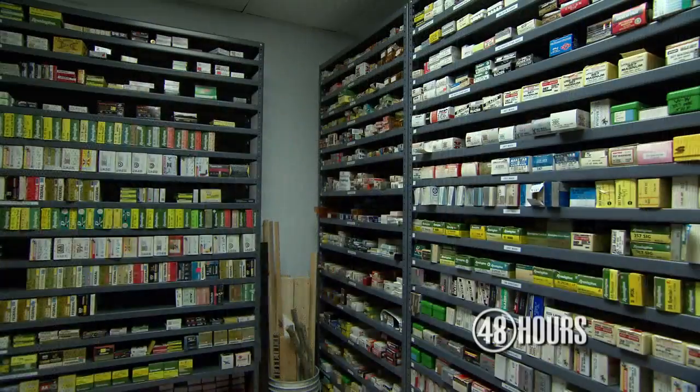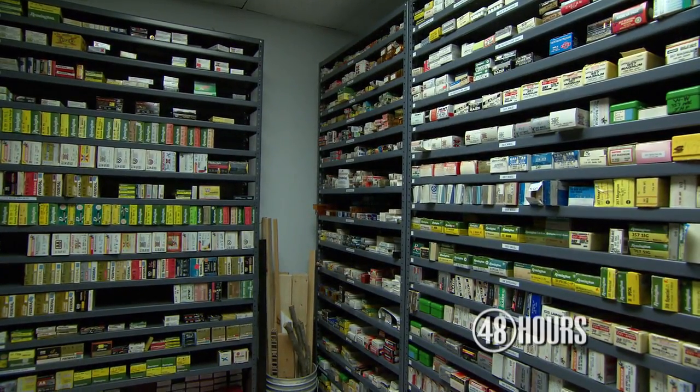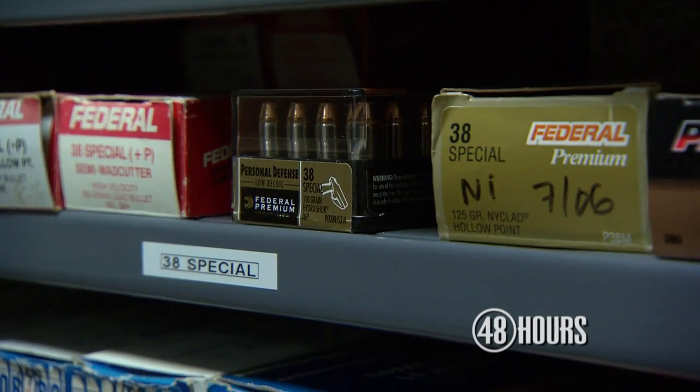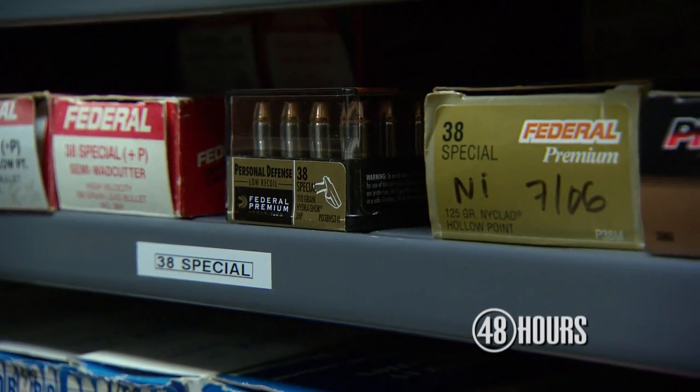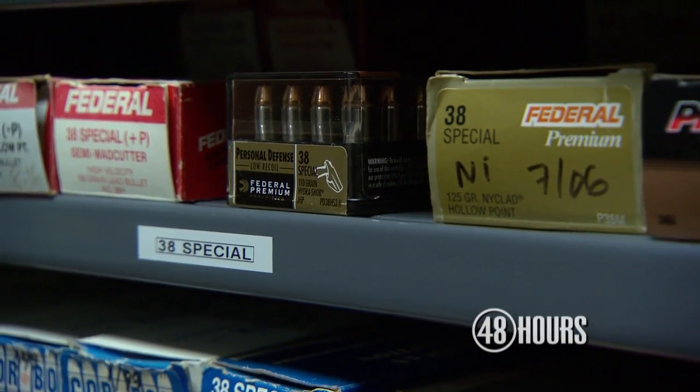We don't have a lot of ammunition from the scene, but we have a lot of lab ammunition. So we want to make sure — although we've gotten the same type of ammunition — we want to look at the reproducibility of our ammunition compared to the suspect's.